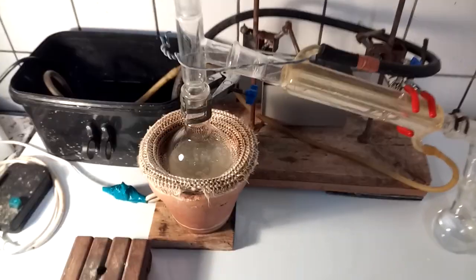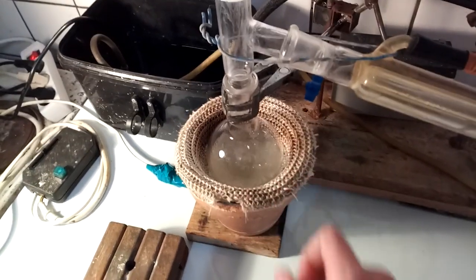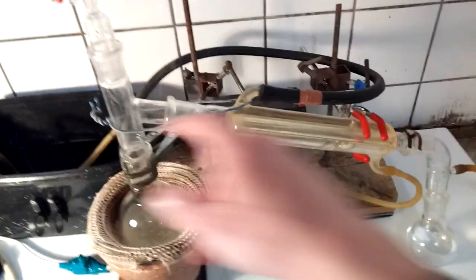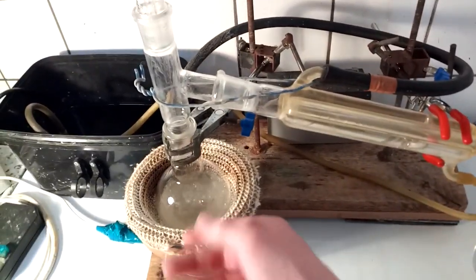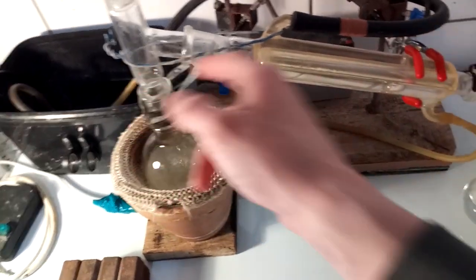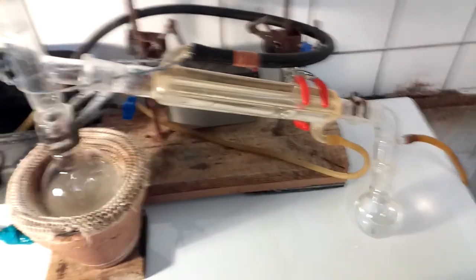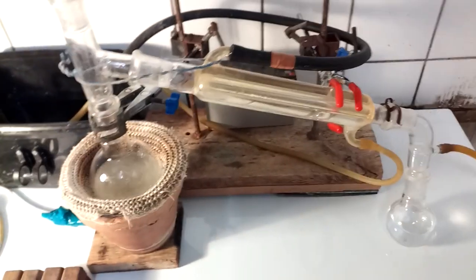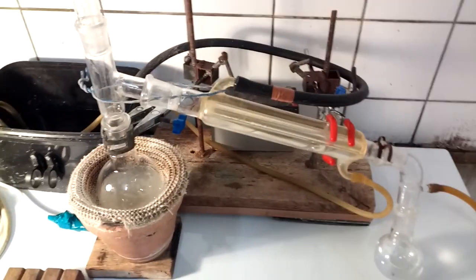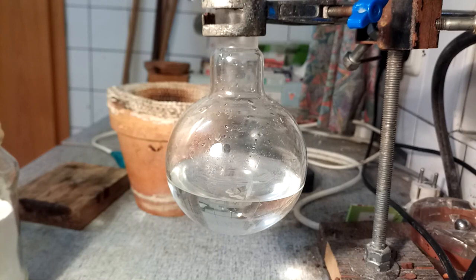That distillation is done. I've put some sodium bicarbonate in solution so it purges the whole system with carbon dioxide and water vapor, and I'm distilling that over just a little so all that nastiness disappears from the setup and we don't get any unwanted lachrymatory surprises. This is the product from that reaction.